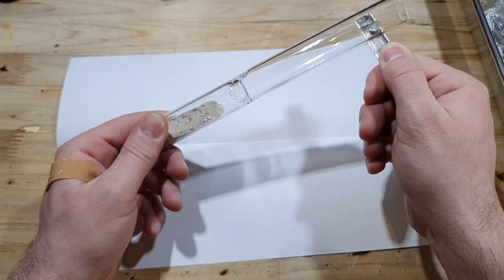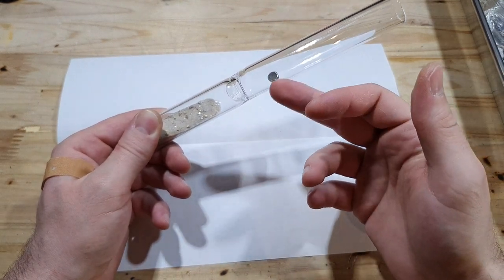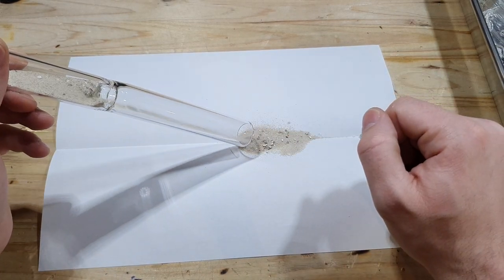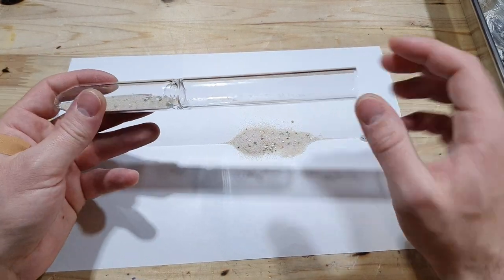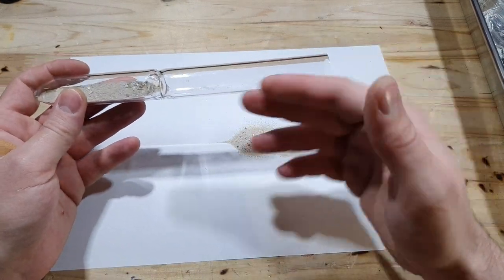Just like that. Normally the magnet or magnetic stir bar stays in there. After that you can just transfer the product into your system. You do have to make sure that the ampoule is connected in a way that the product will either flow out, or if it's a gas you want to transfer into your system, that's no problem.